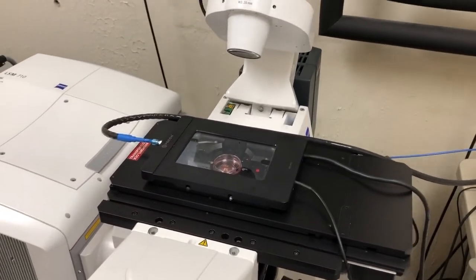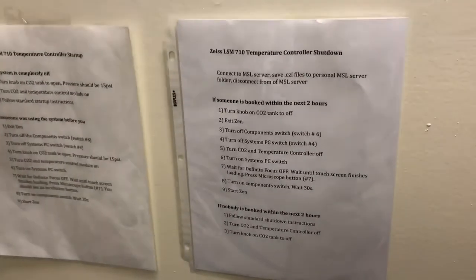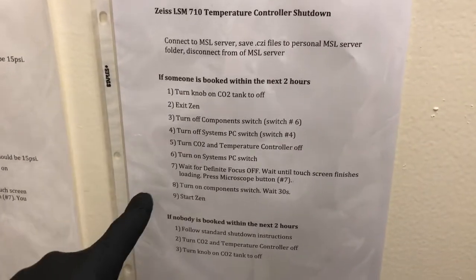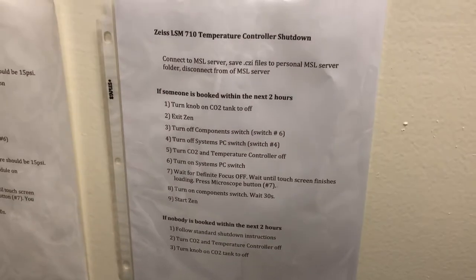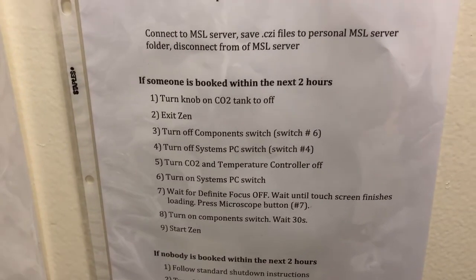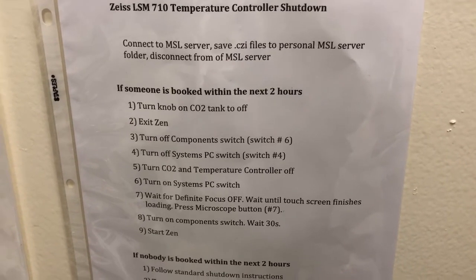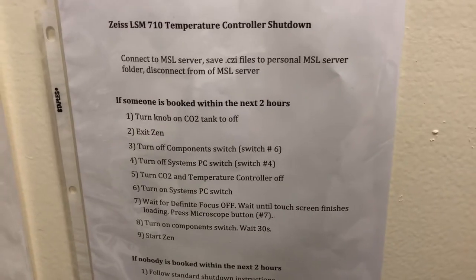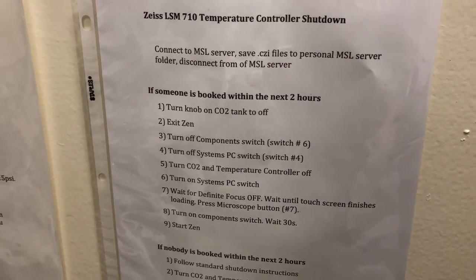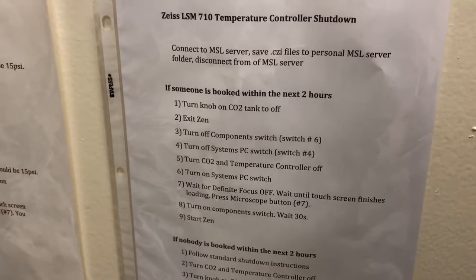So I've concluded my live cell imaging. Now I need to go over how to shut this down. The instructions for shutdown are here, and they're different depending on whether someone is coming within the next 2 hours or not. It just so happens that someone is coming within the next 2 hours, so I need to do this longer shutdown procedure, which will involve shutting down the temperature controller, as well as some other things on the system, and then turning them back on so that the system is working without the temperature controller on. If we just turn off the temperature controller and don't reset the other things indicated here, the next person will get a bunch of error messages.